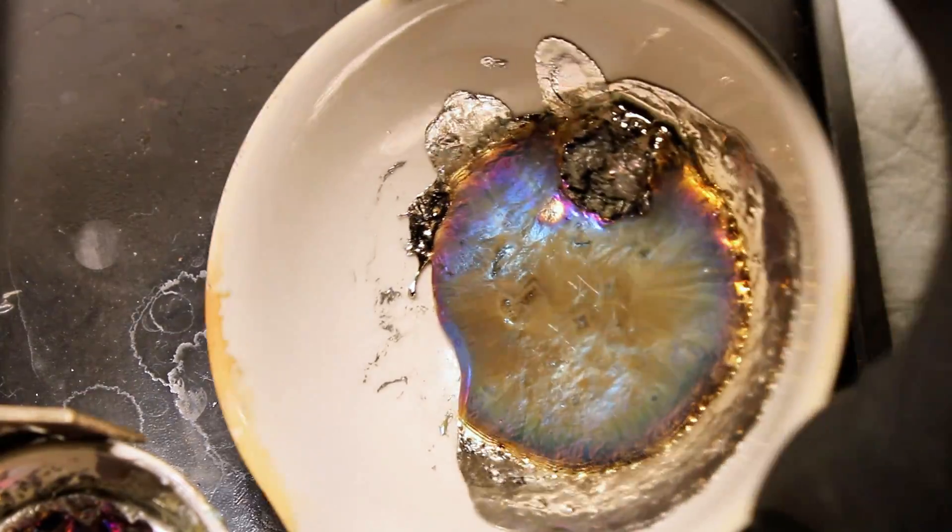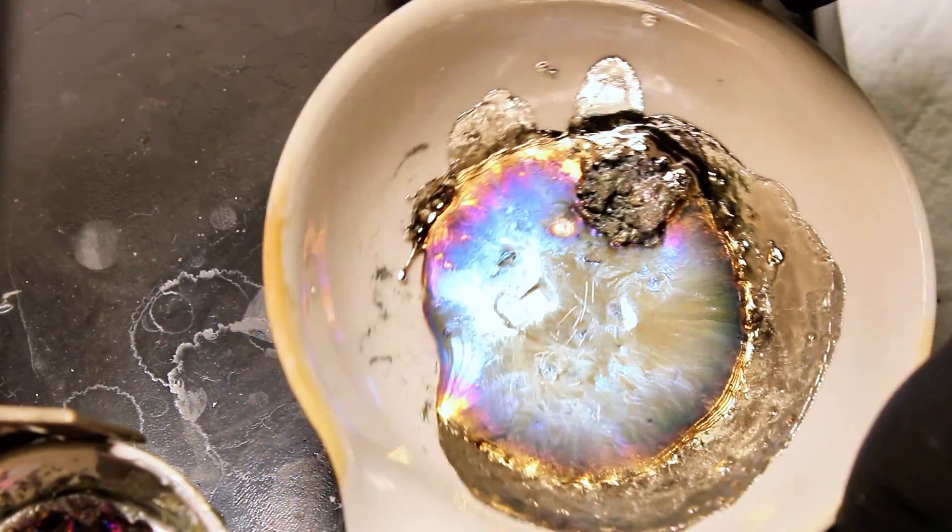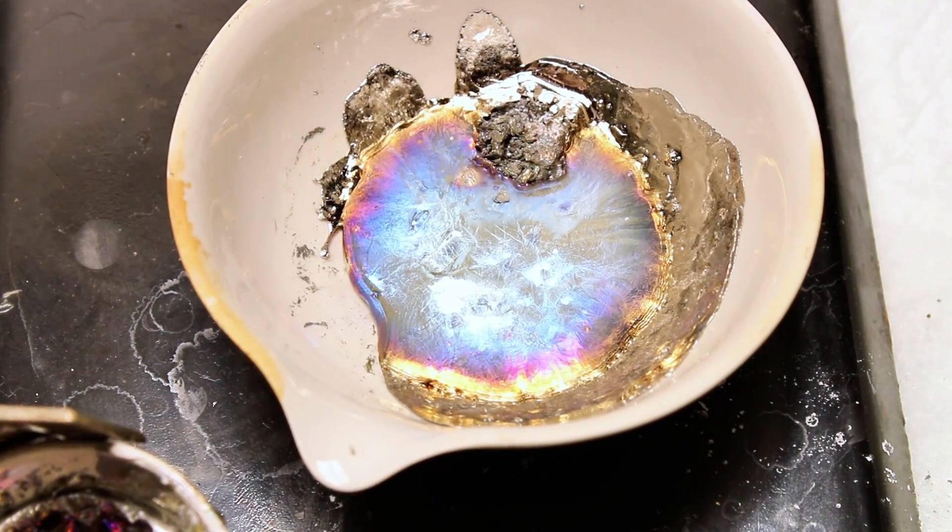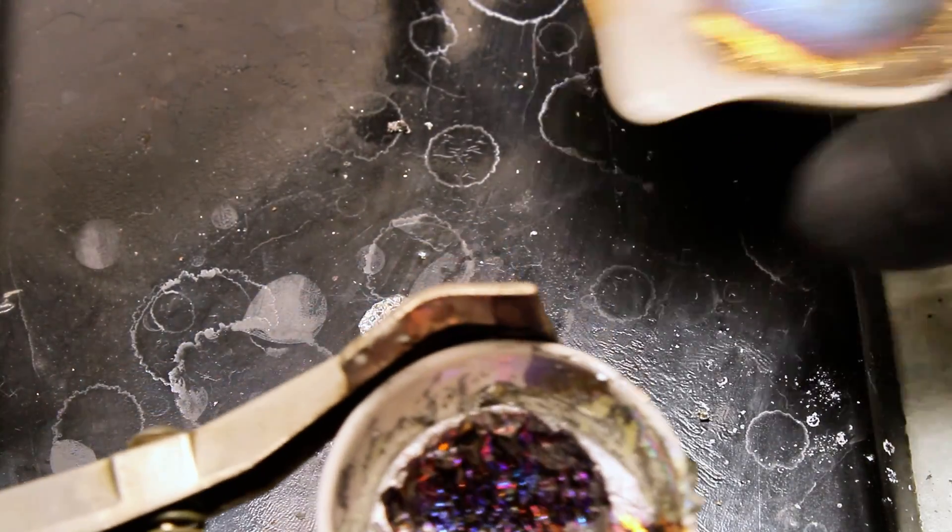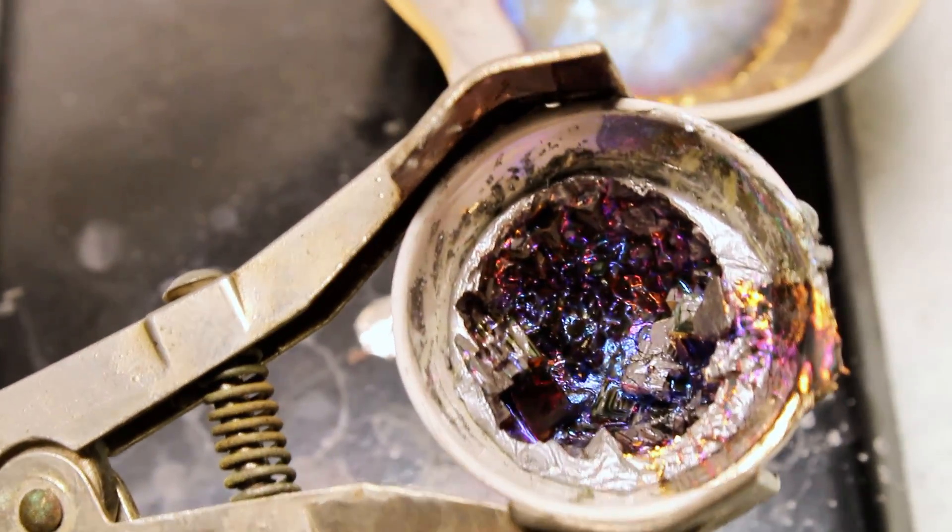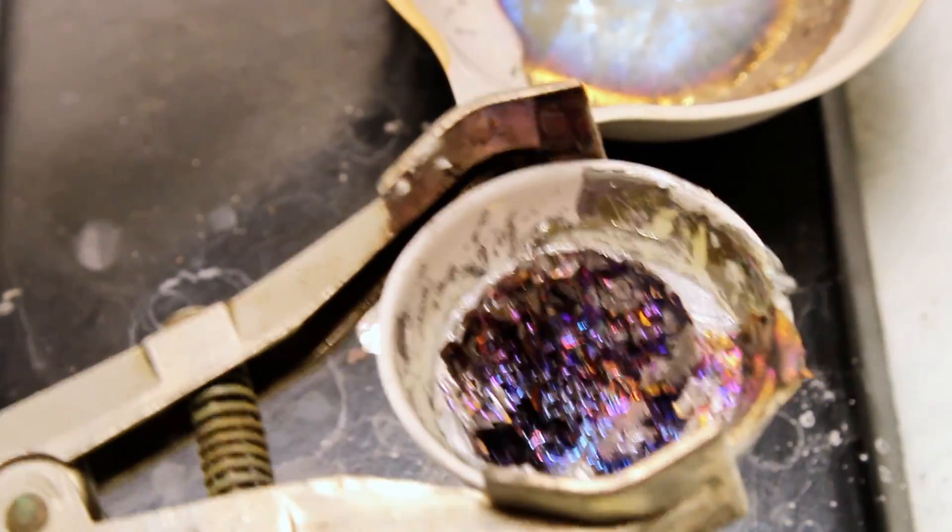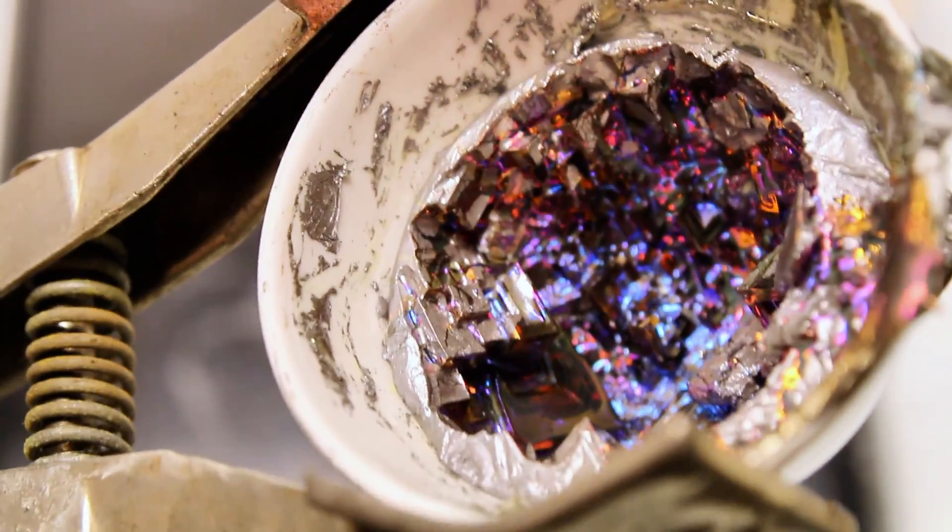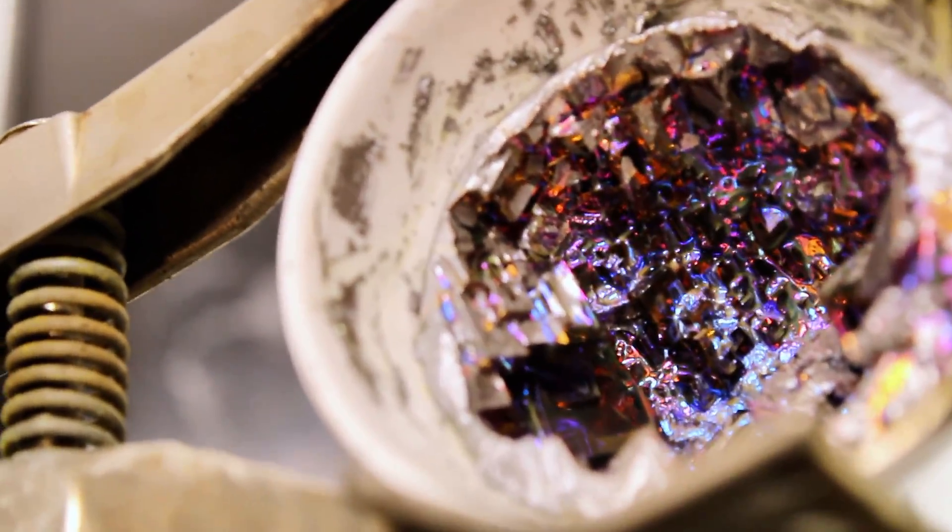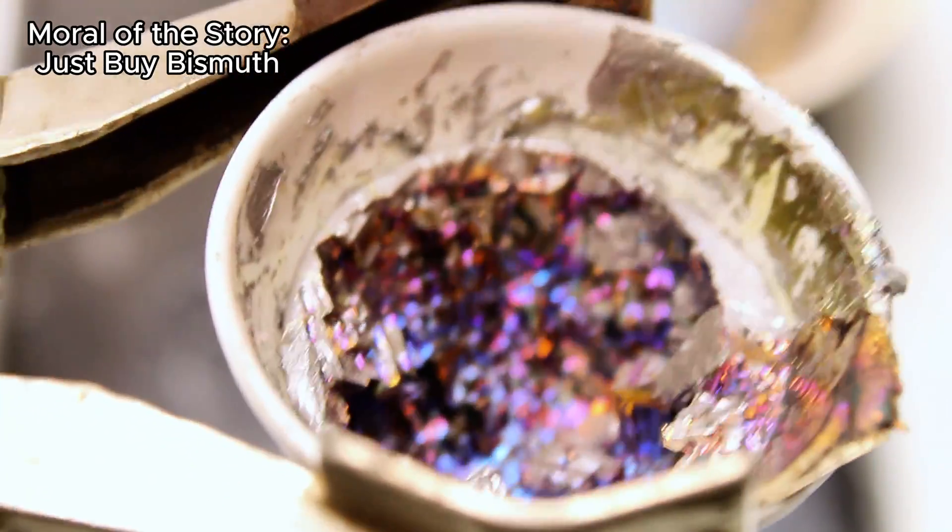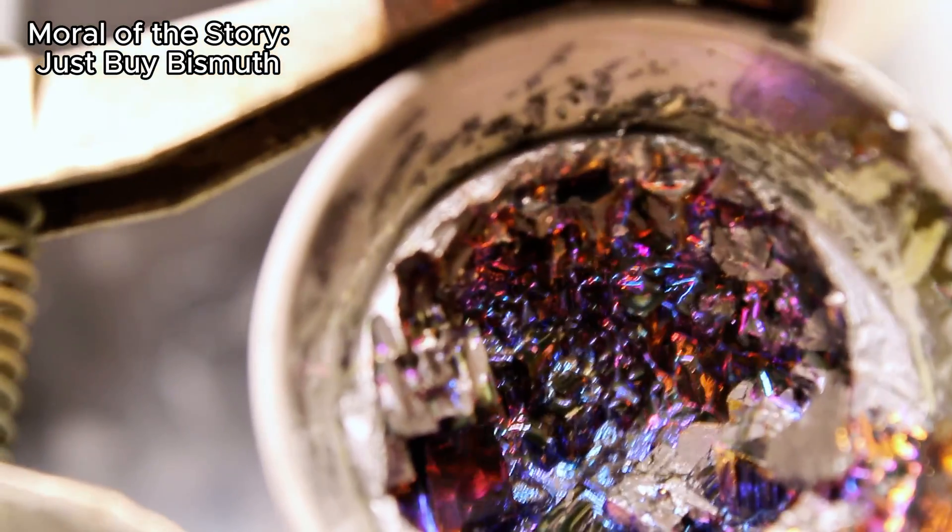A third reason might be that the chemical you're extracting isn't readily available for you as a non-commercial consumer, and some examples here might include styrene, benzene, aniline, etc. And the fourth, final, and most important reason you might do an extraction is for fun. Now, looking at bismuth, bismuth is cheap, it's non-toxic, and so the only reason you'd extract bismuth would be for fun. That said, I wouldn't recommend going this route if you need bismuth for something, but it was an interesting process to do.